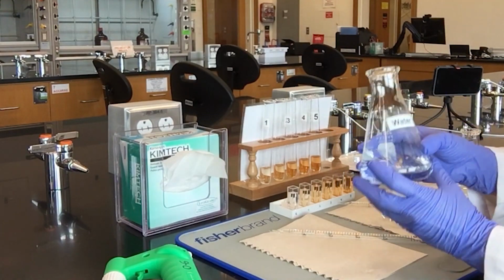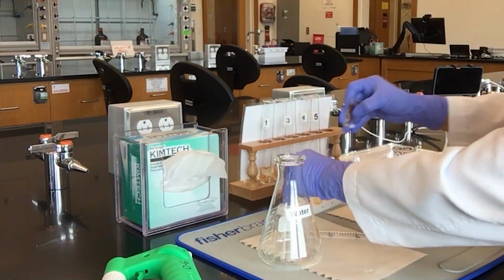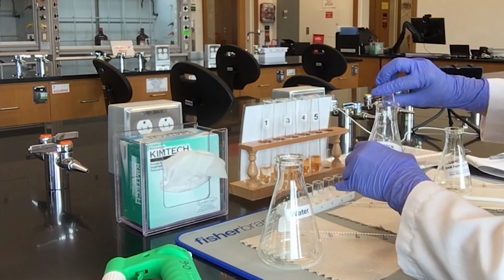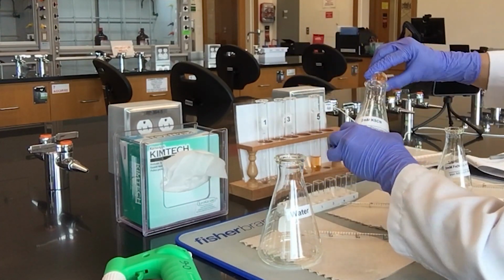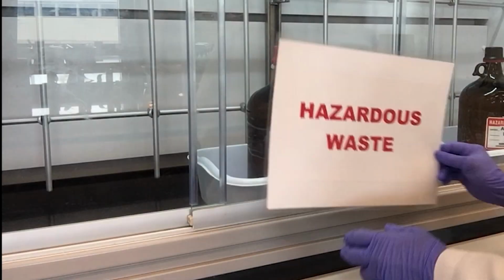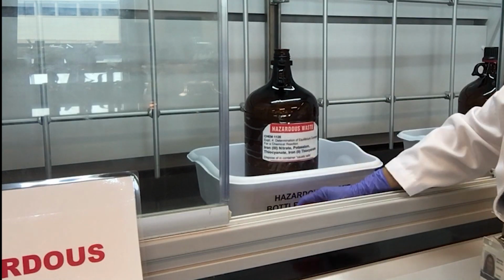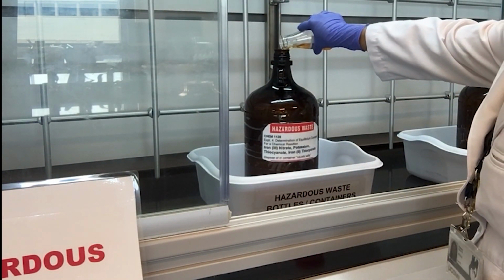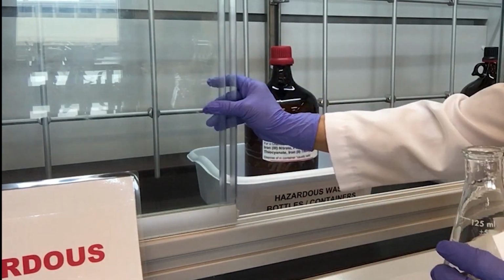Now it's time to take care of the waste solutions. First, water can be poured down the drain. However, all the remaining waste solutions should be gathered into one of the flasks. Dispose the gathered waste solutions from the flask into the labeled waste bottle inside the fume hood. Decant the solution carefully. Put the bottle lid back and slide the hood doors.